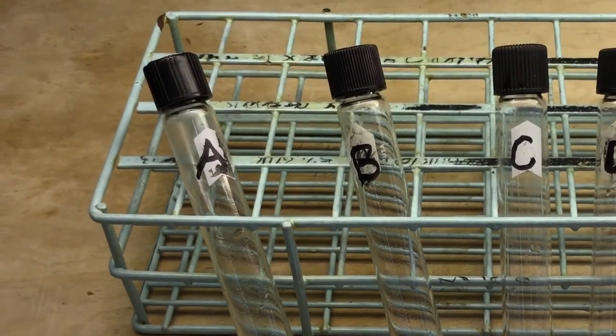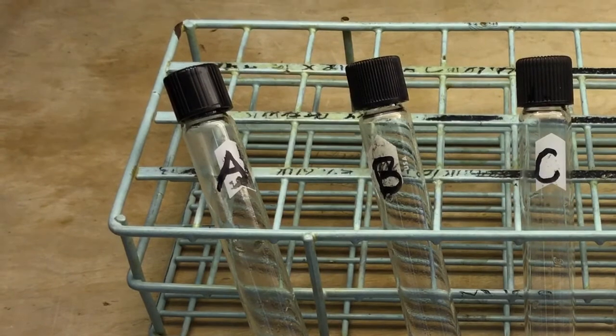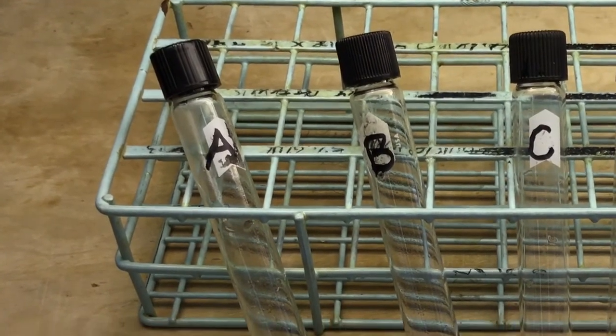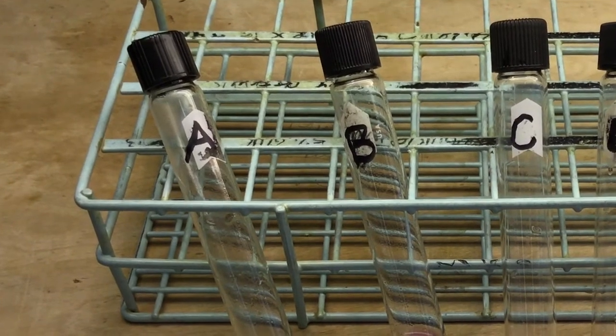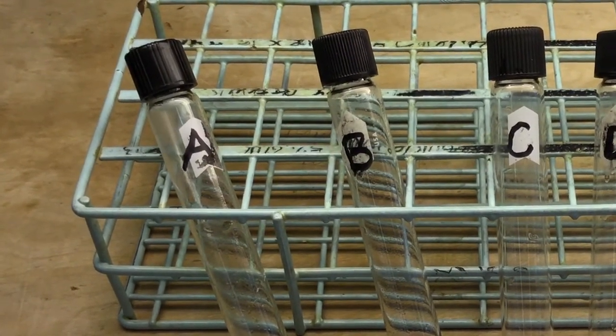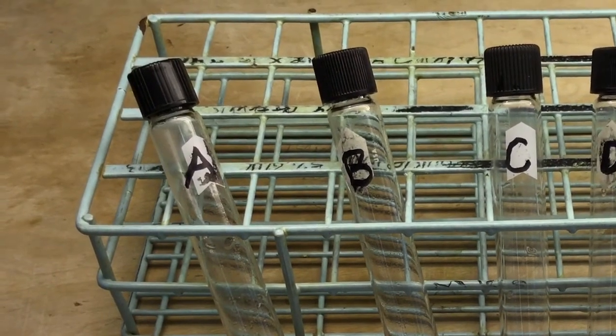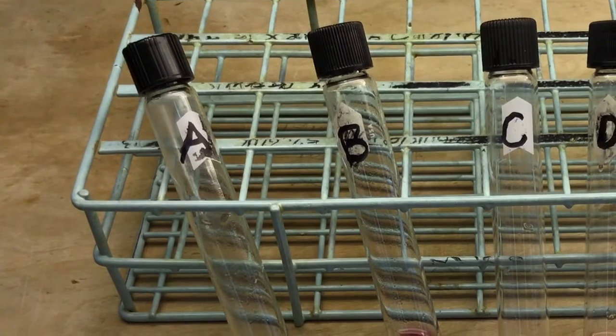So 45 minutes has passed. The foil has been removed from test tubes A and D. So here are the final colors of the indicator in all four test tubes. There will also be a picture in the lab eight document as figure number two. Record these results in table one of the assignment worksheet and include it with your scientific write-up.